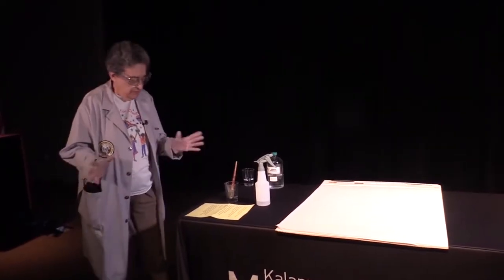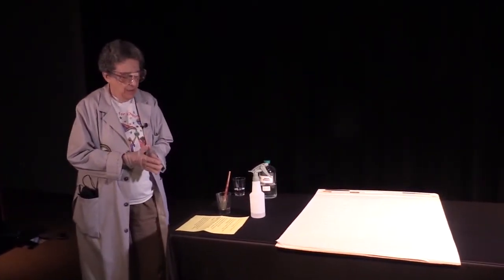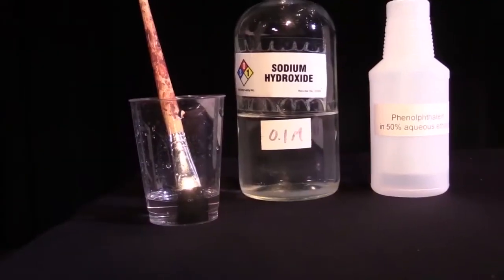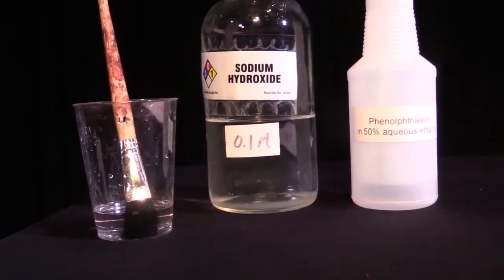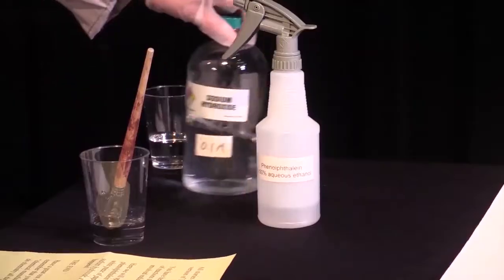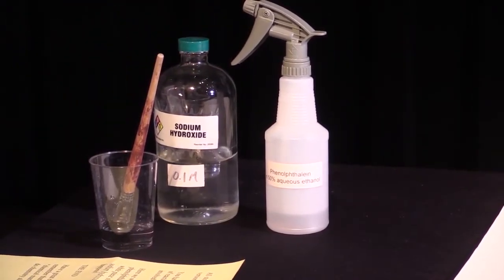All stories come to an end, and so does this version of The Wizard of Oz. You have heard about lots of different types of reactions today, a number of which involved indicators. Here we will spray the indicator phenolphthalein on 2 words, which I'm going to write on a white piece of paper with a solution of sodium hydroxide. That's a base.